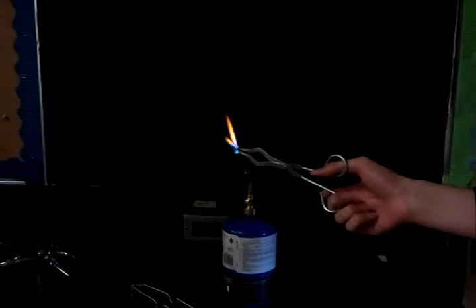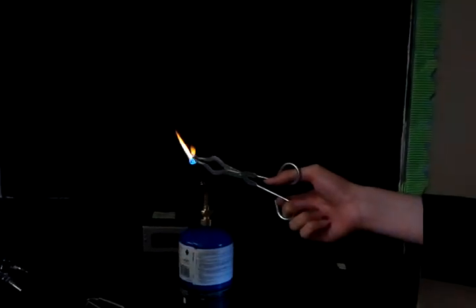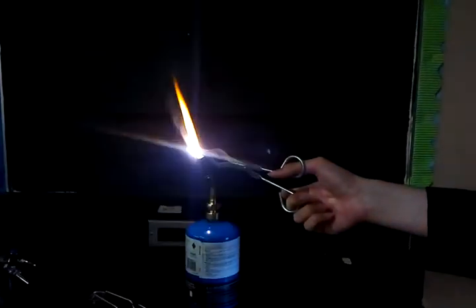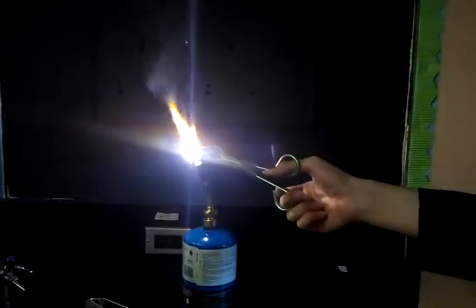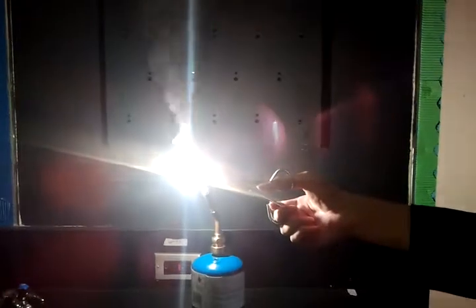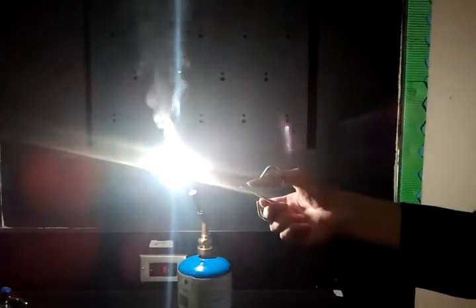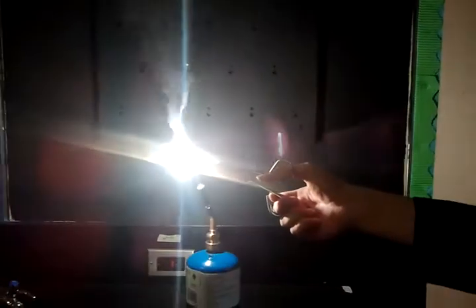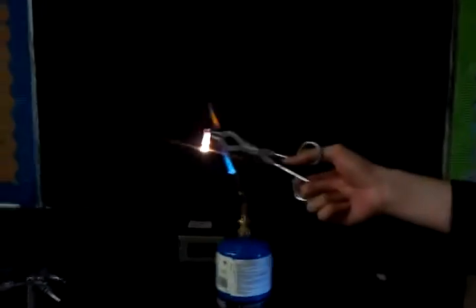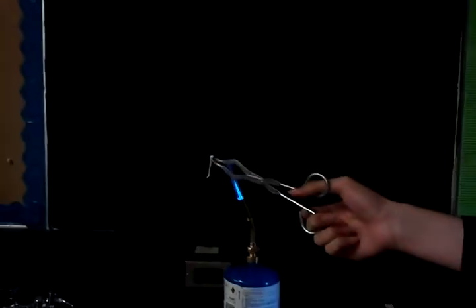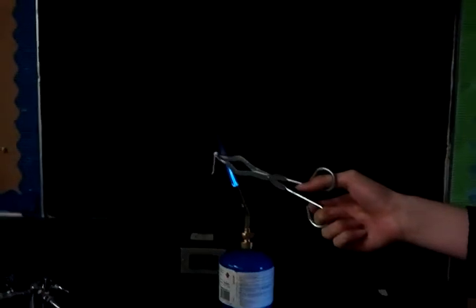Wait, what is it, the low battery? You see the waste of some magnesium right there? Hey! This is the camera. Low battery. There we go. You can't see!